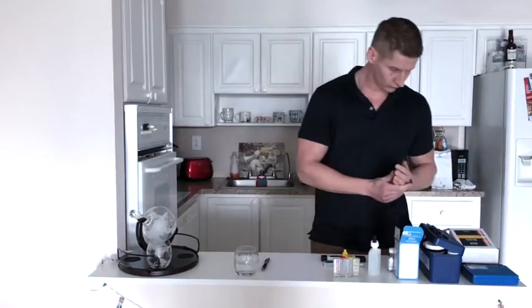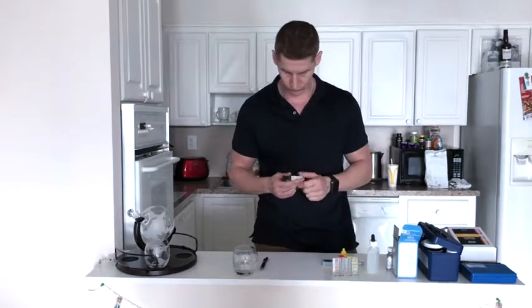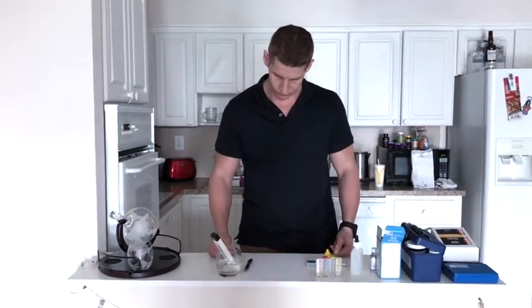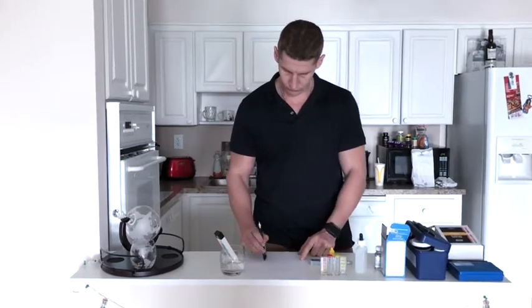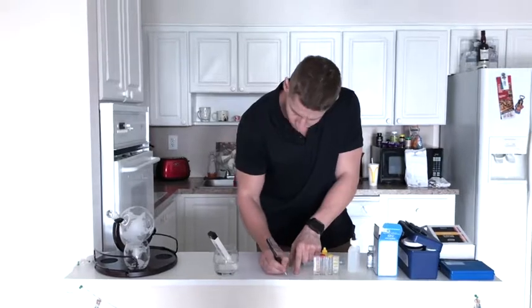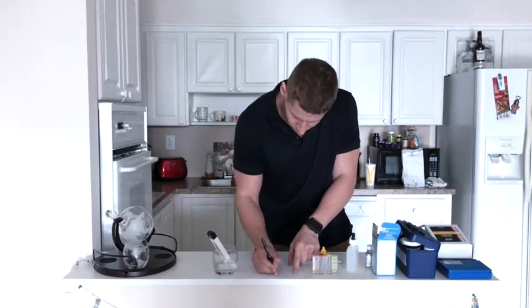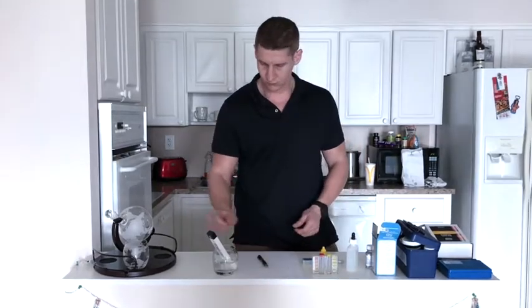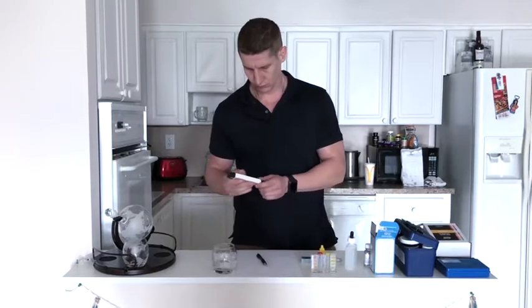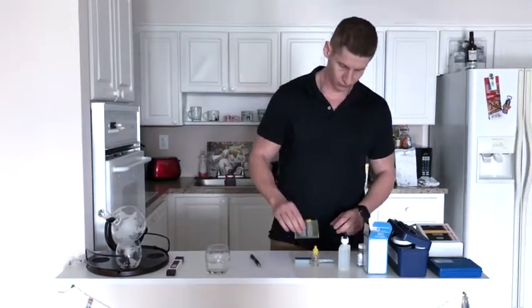There's a 10-point water test to reveal the existence of the following contaminants in your tap water. Number 1, TDS test, a major water quality indicator of the total number of dissolved solids. TDS in drinking water originates from natural sources, sewage, urban runoff, industrial wastewater, and chemicals used in the water treatment process, as well as the nature of the piping or hardware used to convey the water, such as your plumbing. The current number of TDS is 123 parts per million.